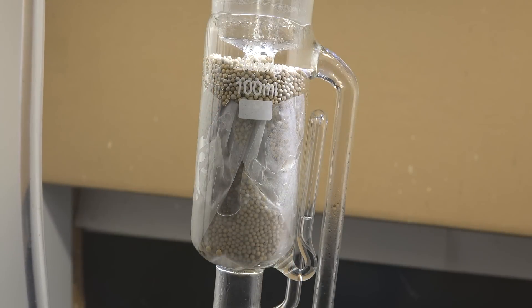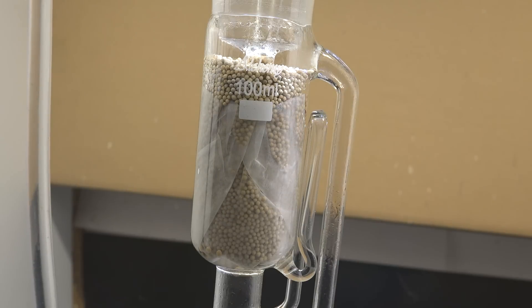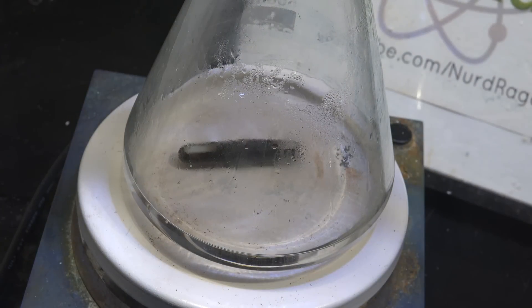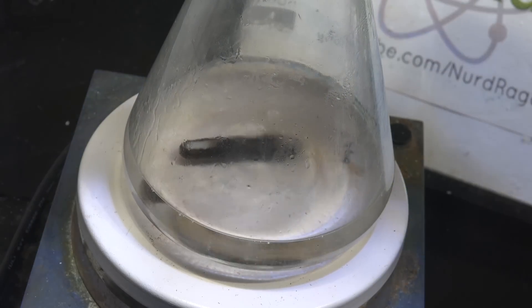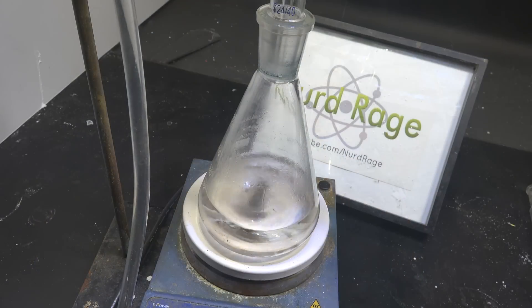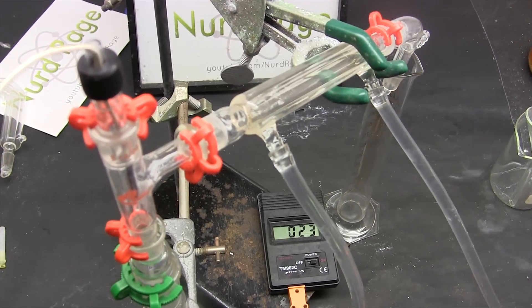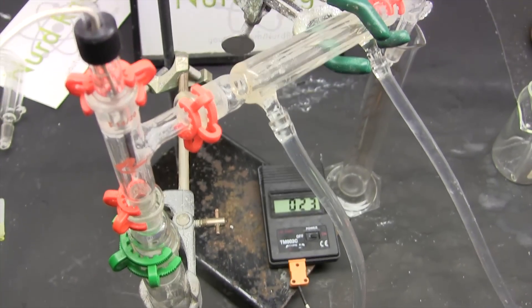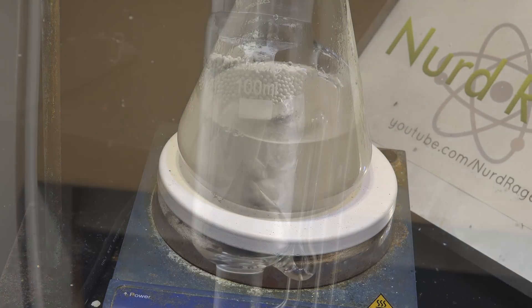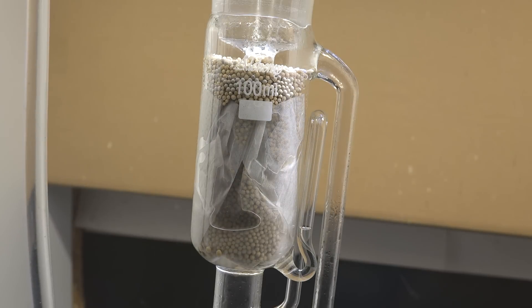I'm quite pleased with how well the Soxhlet extractor with molecular sieves worked — my bet that water was in the low-boiling azeotrope paid off. This procedure wasn't even optimized yet; I used twice as much ethanol as necessary because I was roughly copying the old method. If the water is still effectively removed, we don't need an excess of ethanol — a stoichiometric amount might work better and give even higher recoverable yield. Another option would be to use an excess of propionic acid for complete conversion of ethanol, then directly fractionally distill pure ethyl propionate from the mixture — no water washing or additional molecular sieve drying needed. The molecular sieves used in the Soxhlet extractor can be dried and reused, so the procedure doesn't waste any chemicals. This is what I love about having a new tool for chemistry — it might change just a single step, but it can radically change your procedures in ways that open up whole new pathways.